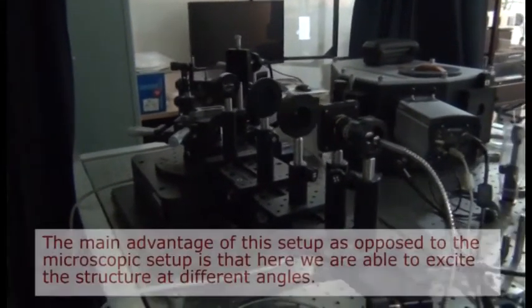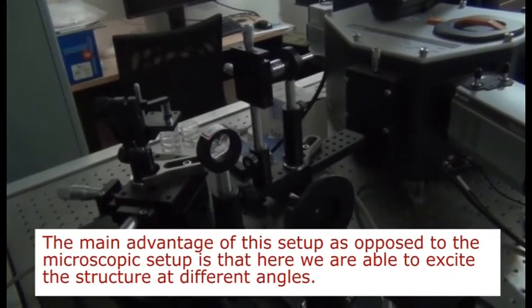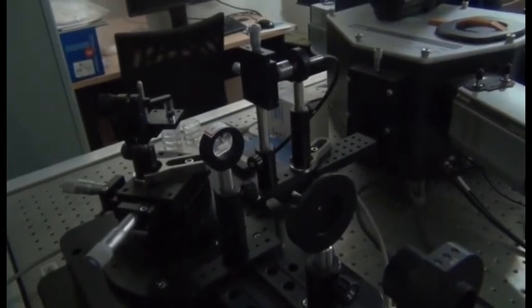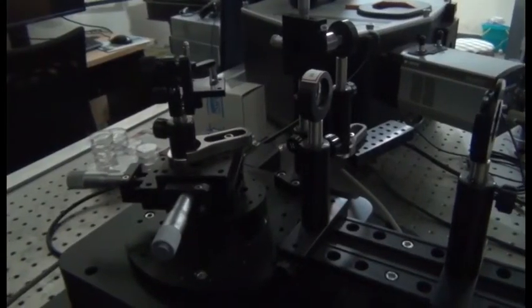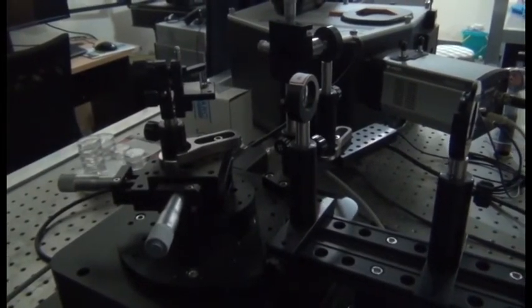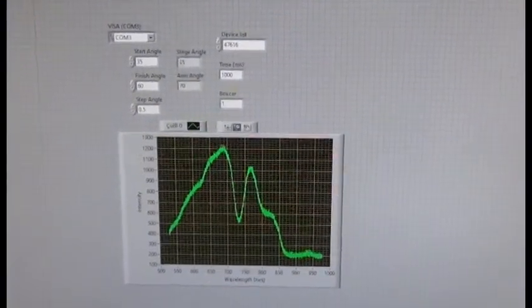In the excitation part, a white light source is used, which is coupled via a fiber, which is then passed through a polarizer, so that we can control the polarization of the light that is incident on the prism. Then the light hits the prism, and on the other side of it we have the sample. The reflected light is then collected through a set of objectives and analyzed using a small spectrometer. In this case, a portable spectrometer is used, which allows the system to be movable.